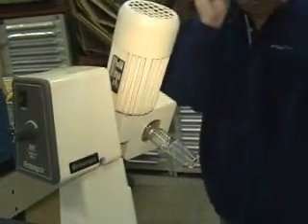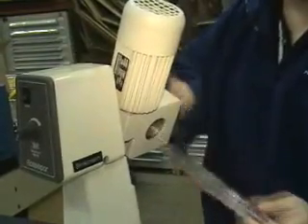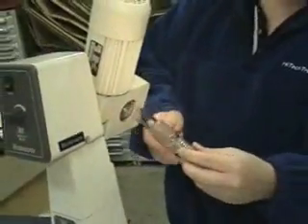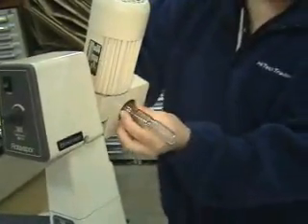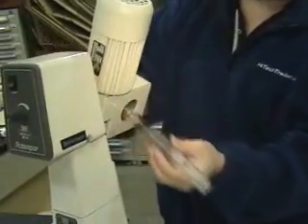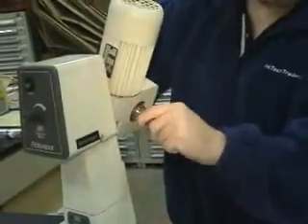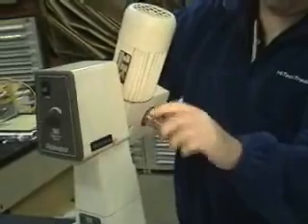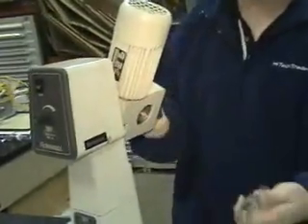Put on my safety glasses. When removing this item, please be careful. If you insert the vapor duct for the 114 into the RE-111-121, it doesn't fit. There's no clicking. You might get some movement, but if you connect your system, chances are it's going to fall out and break.